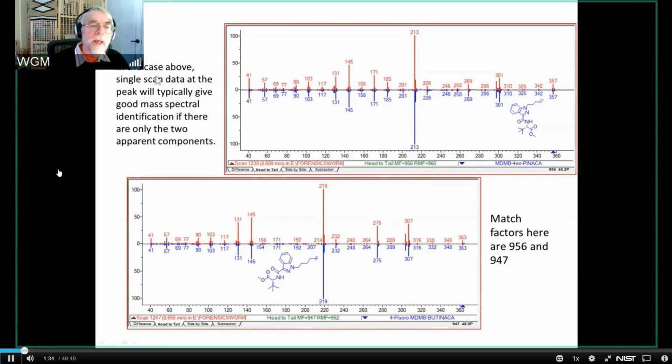So in that case that I just showed you, this is the earlier component, a single scan. This is scan 1239. This is scan 1247 in that data file. And I get extremely good identification. You'll see that I've got an identification factor of 956. I have a lower probability. That just simply means there are other components in the library that have very similar spectra, and a match factor of 947 and comparable, fairly high quality, but not great probability of correct identification.